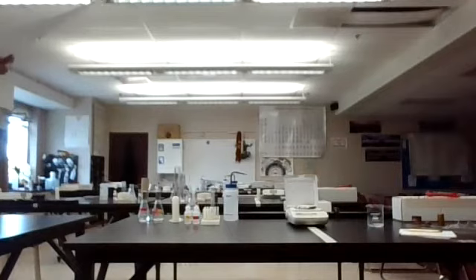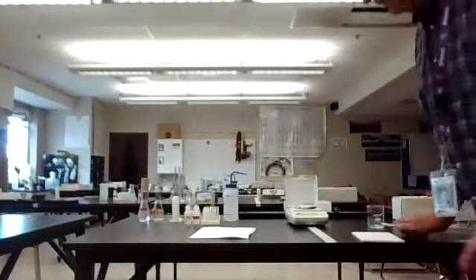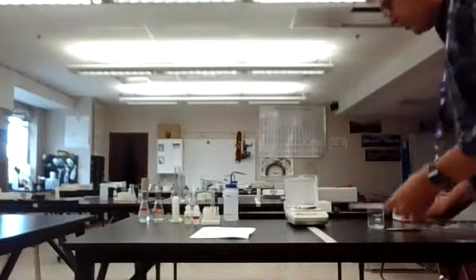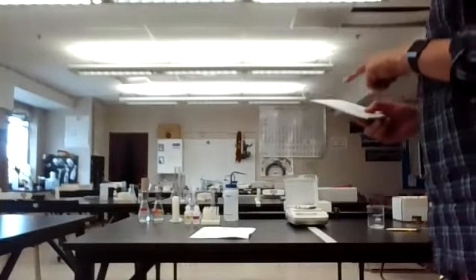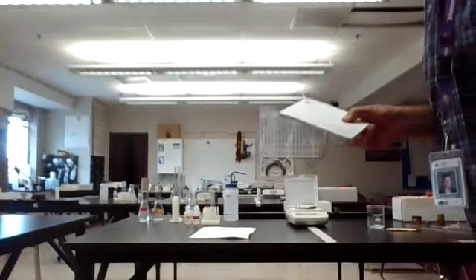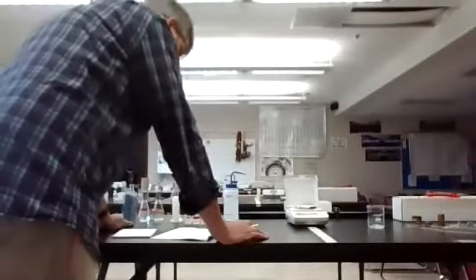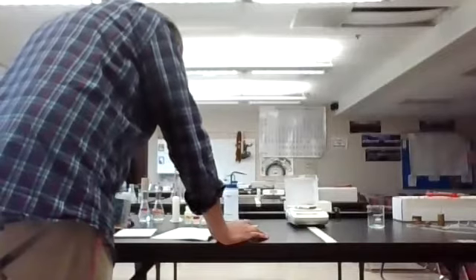So the first part, obtain the mass of the evaporating dish and ice cube together. Well, I didn't use an evaporating dish, I used a beaker. But just to get it started, because it takes quite a while, I went ahead and did this one without putting it up there. The mass of the ice cube and the beaker together is 115.63 grams. I will also give you this data at the very end. That's going to continue to build to the very end.